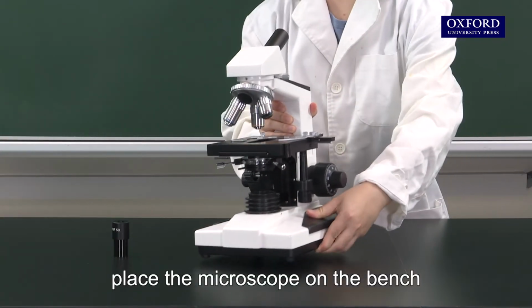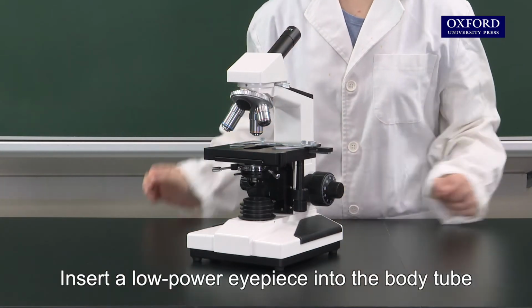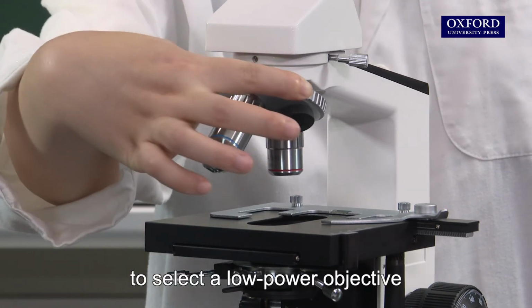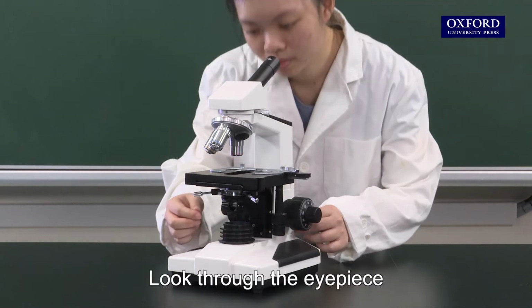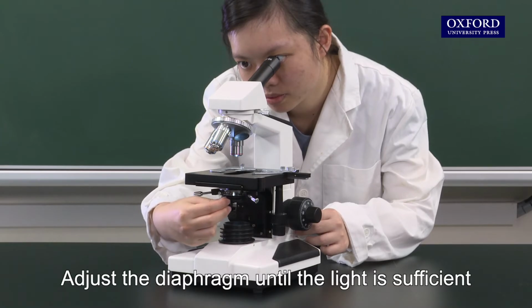First, place the microscope on the bench. Insert a low-power eyepiece into the body tube. Then rotate the nosepiece to select a low-power objective. Turn on the light source. Look through the eyepiece. Adjust the diaphragm until the light is sufficient.